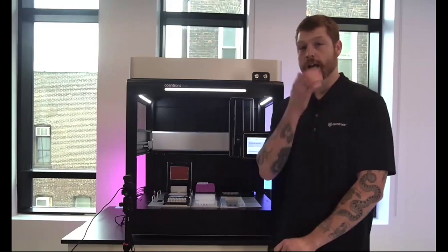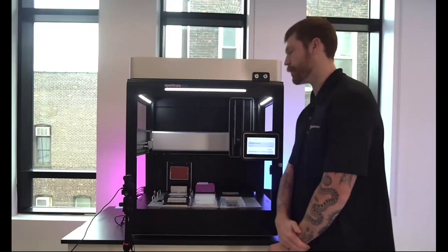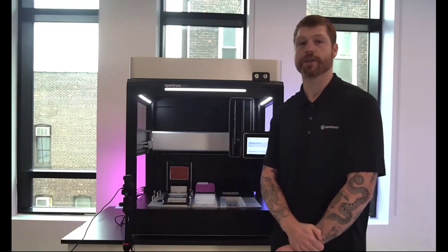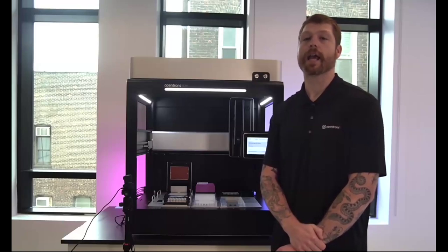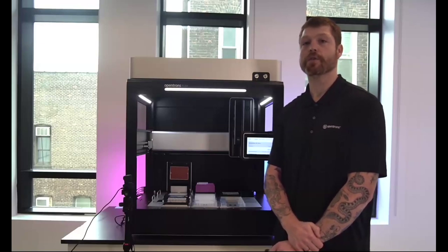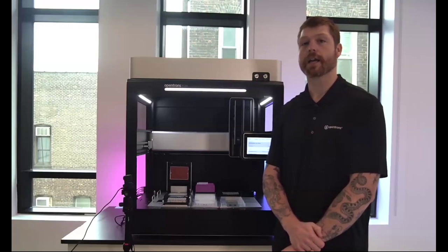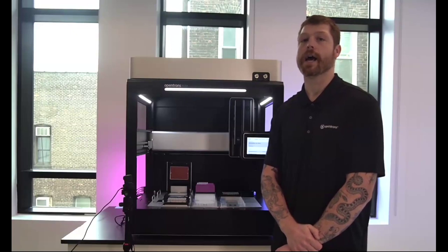Next, to talk about the gripper, unfortunately, we do not have a gripper on this system. It's not really relevant for the workflows that I'll be showing you today. But typically, that will sit to the right hand of the pipettes. It's really easily removed and added on. You do not have to start with the gripper in your first configuration of the instrument. You can always add them on, as is true for pretty much any of the modules or pipettes that we'll be talking about here.